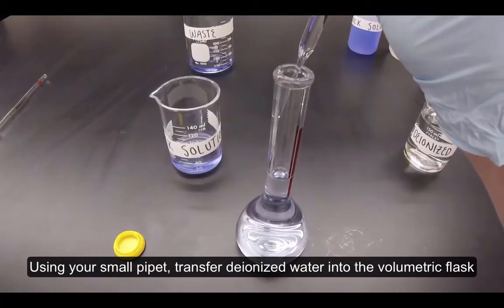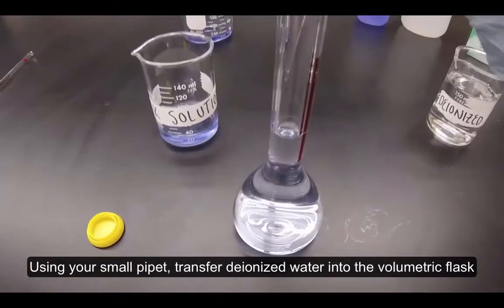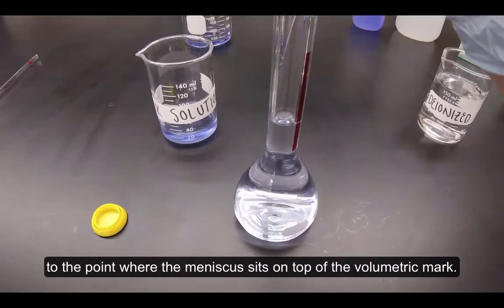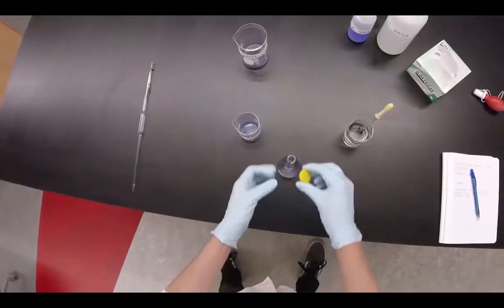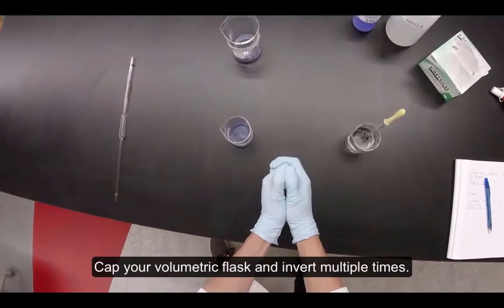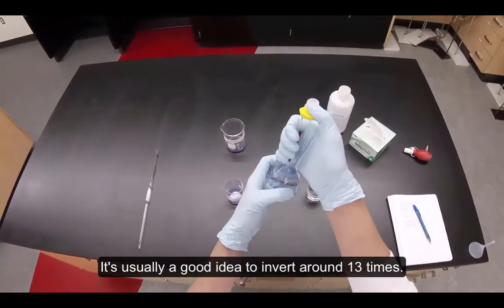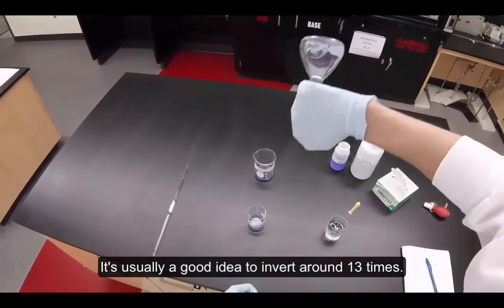Using your small pipette, transfer deionized water into the volumetric flask to the point where the meniscus sits on top of the volumetric mark. Cap your volumetric flask and invert multiple times — it's usually a good idea to invert around 13 times.